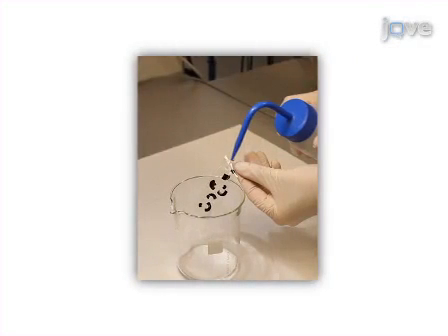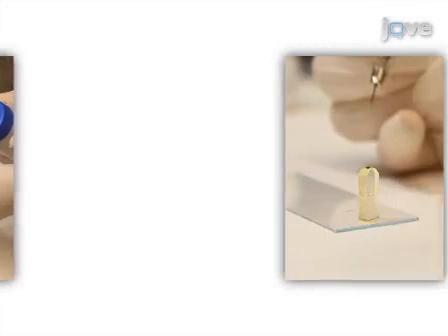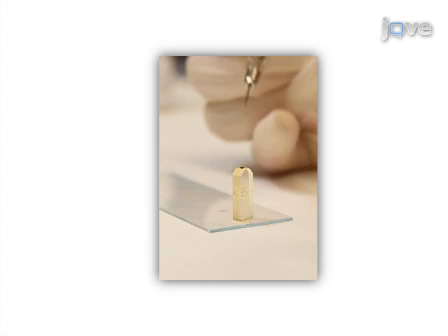This is accomplished by first sectioning the brain into slices that are stained and then resin embedded. The second step is to cut the region of interest from the embedded brain section and mount it onto a blank resin block.